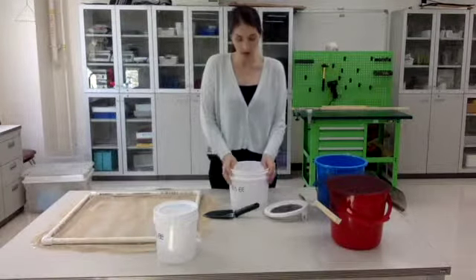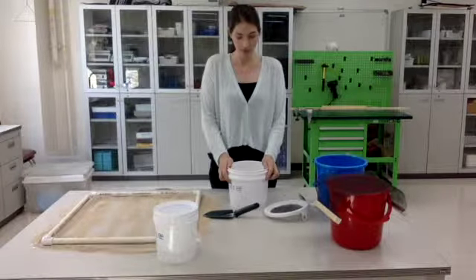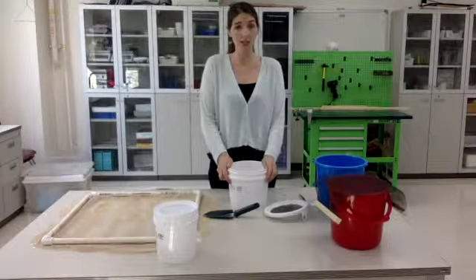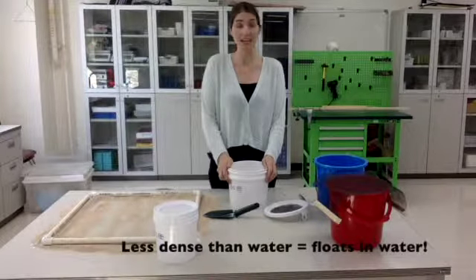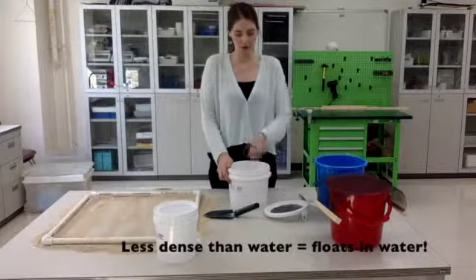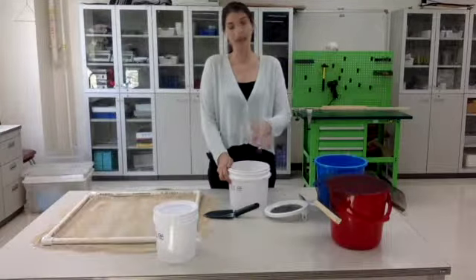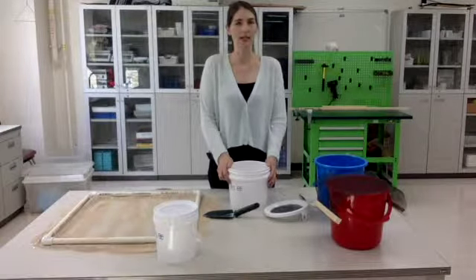So now I want to make sure that I didn't miss anything. And so what I'm going to do is fill this bucket with water, and a lot of the plastic particles are not as dense as water, so that means they're going to float. So if I stir it up a little bit, I should be able to get out any of the plastic particles that are less dense than water and make sure that I get them all.